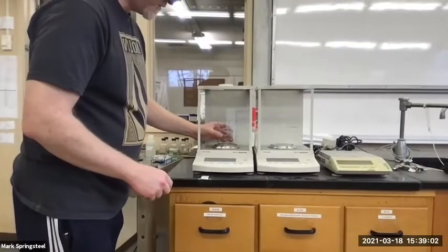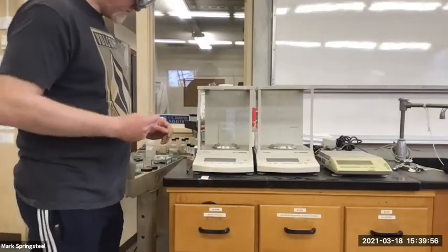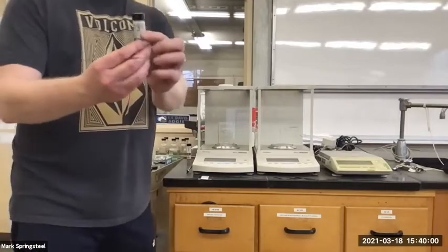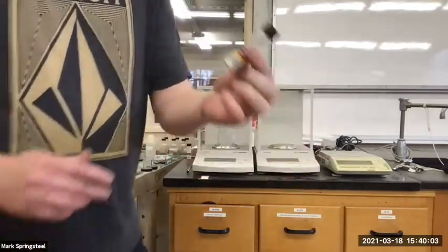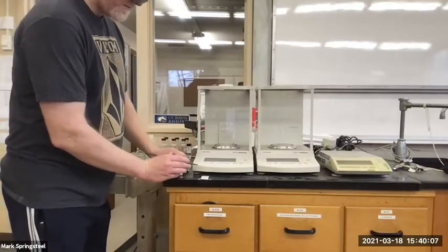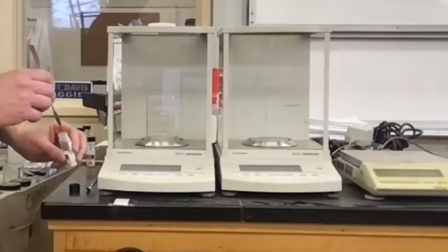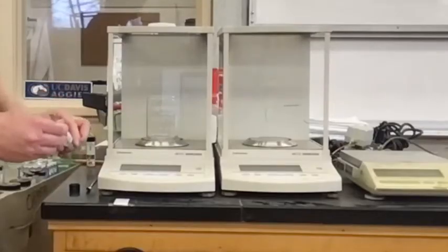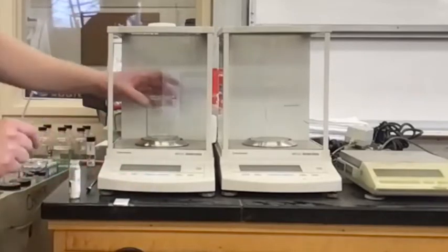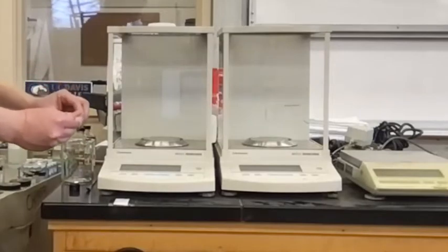So first thing I'm going to do is zero out the beaker. Actually, before the dibromobenzene, I'm going to add this one here. I'm not letting you see the label, but it's a white solid. This one is the neutral compound, and I want to add about 0.5 grams. Should I add it while it's on the scale? No, I'm going to take it off the scale. I'm looking for about half a gram.